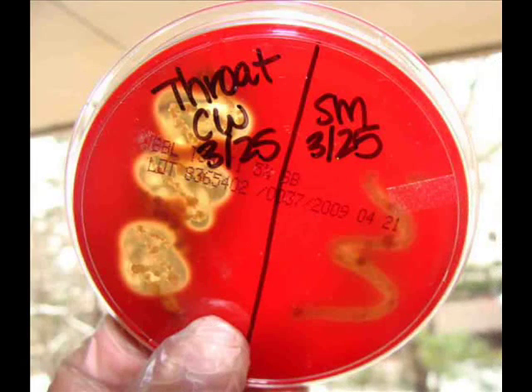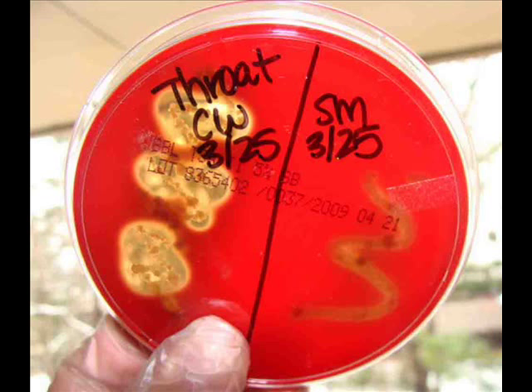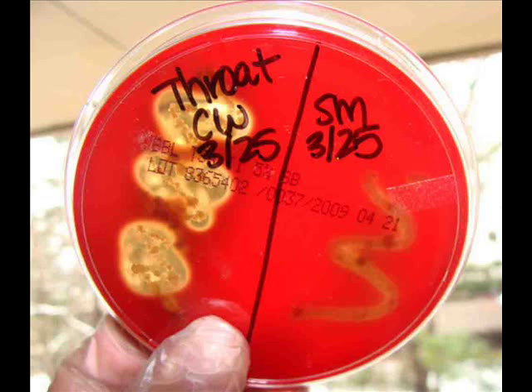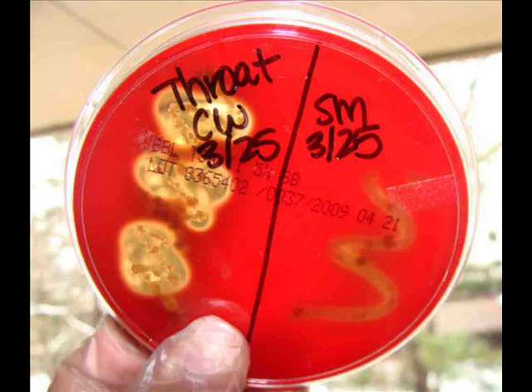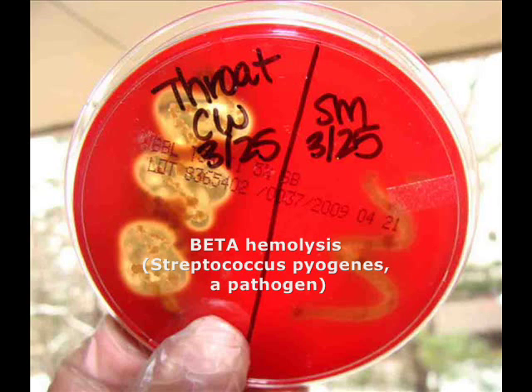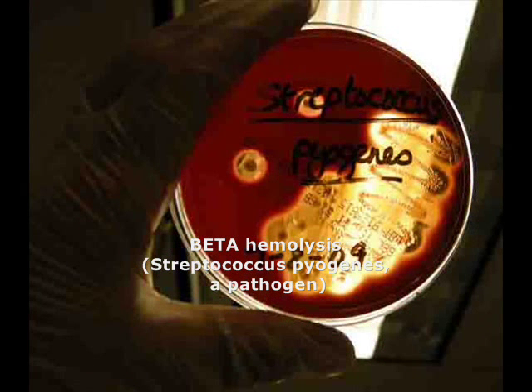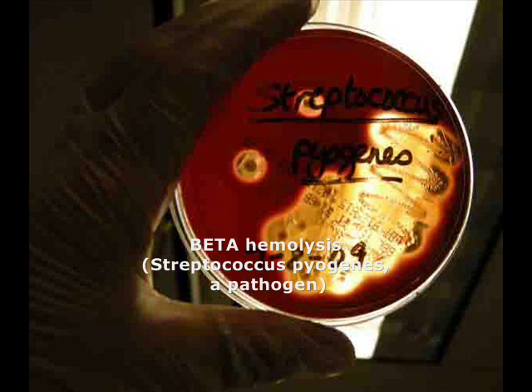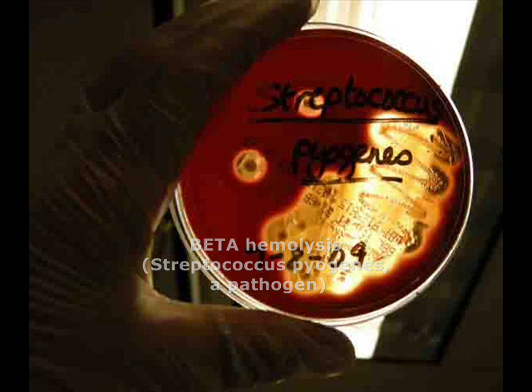When I look at the left side of this plate I can see that the bacterial growth resulting from this throat sample has removed the color from three areas. These transparent spots on the plate indicate beta hemolysis. Beta hemolysis from a throat sample plated on blood agar indicates the presence of pathogen Streptococcus pyogenes.